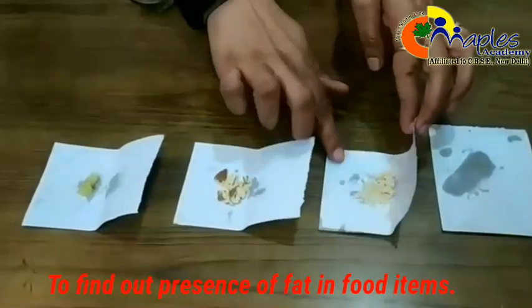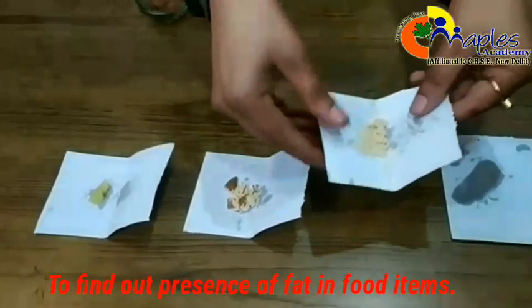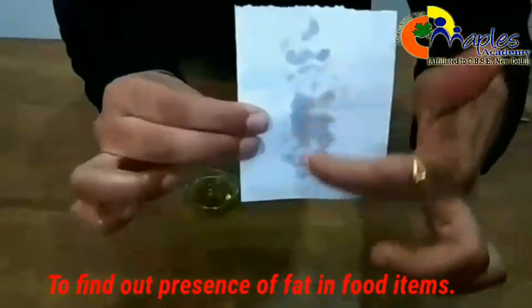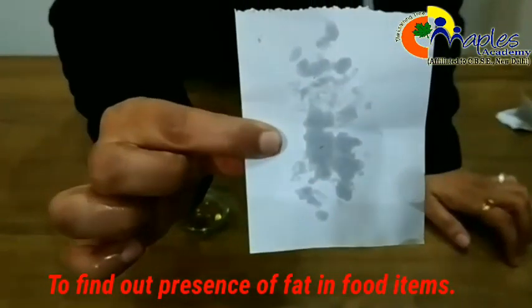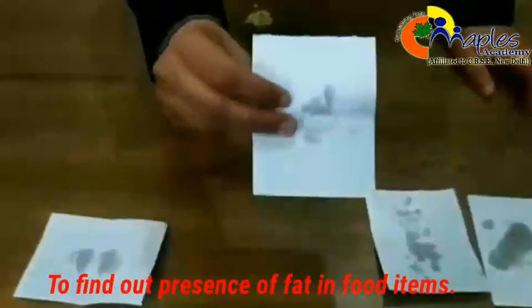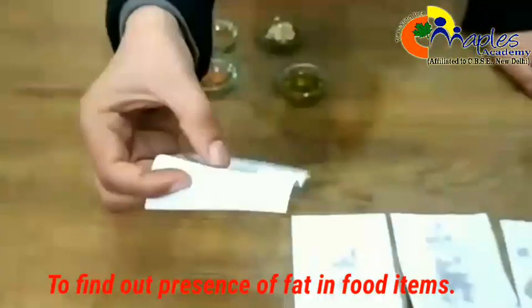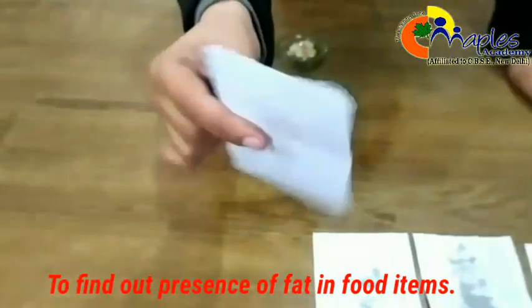Now we are going to check the translucent effect on the paper, right? So put all the crushed material back into place and then we are going to check it. Now, if we pass a light through it, we can easily observe where the crushed particles of peanuts were. The paper becomes translucent from there, showing these oily patches. The same thing happened with the groundnut. The oily patches are observed on the paper where the groundnut has been crushed. And for the third, not oily patches but a water-like substance is observed on the paper, which is not properly translucent like these.